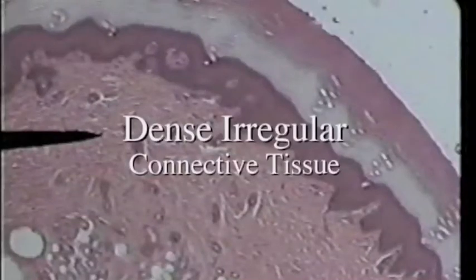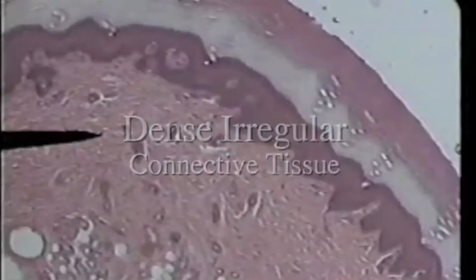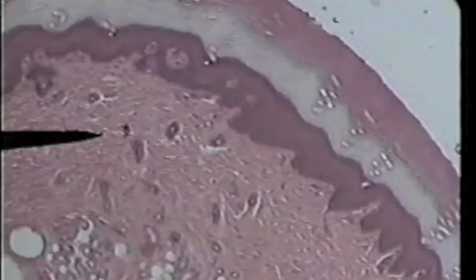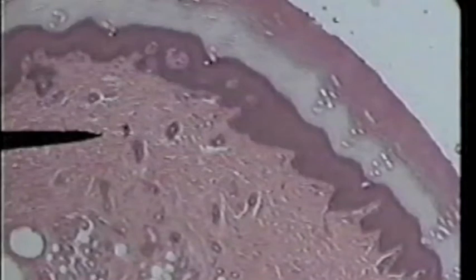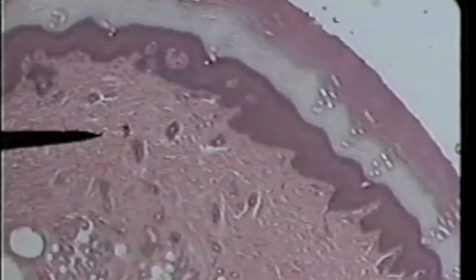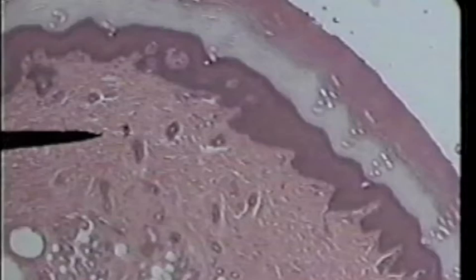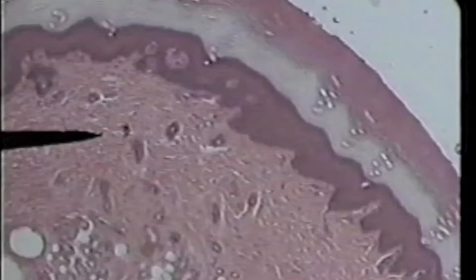Now let's compare dense regular connective tissue with dense irregular connective tissue. We'll go back to our thick skin slide. The tip of the pointer here is between the epithelial layer that you see at the top of the slide, which is the layer on the surface, and the adipose layer which is deep within the tissue.